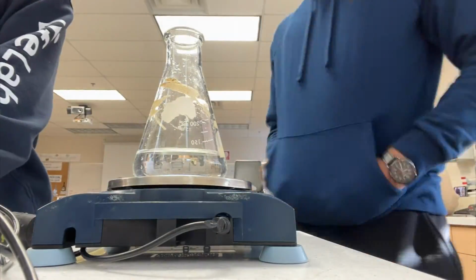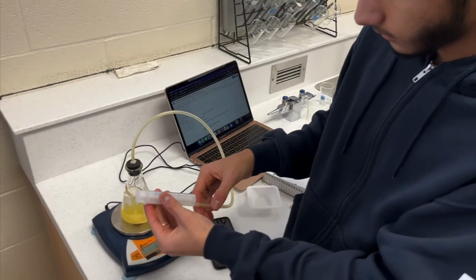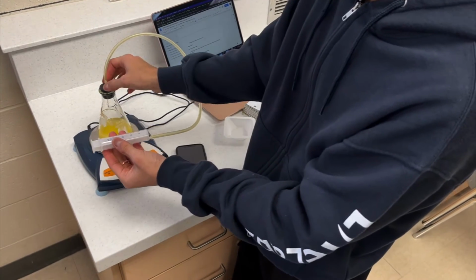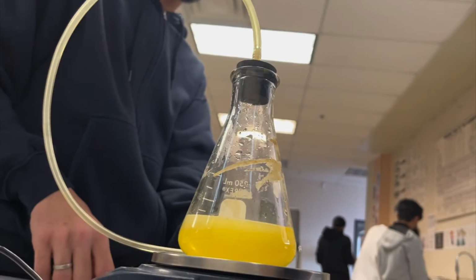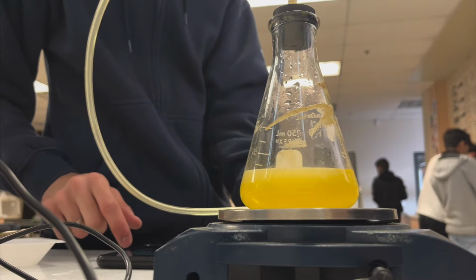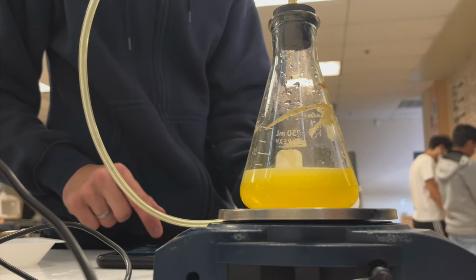Let's go ahead and take a look at some of the clips from when the lab was being conducted. The way we will know that the reaction has occurred is if at least one of the following conditions is met: a change in temperature, an evolution of gas, or a precipitate being formed. Out of the three main criteria, only one bar was met, an evolution of a gas, presented as a formation of bubbles.